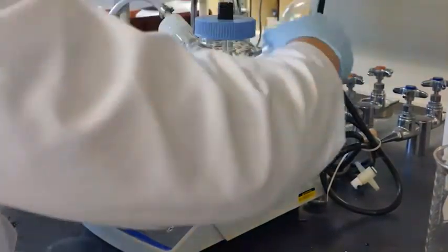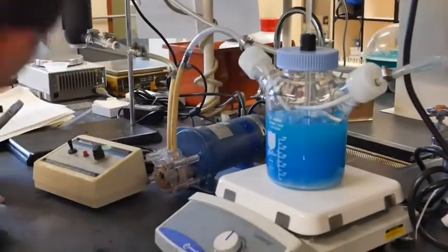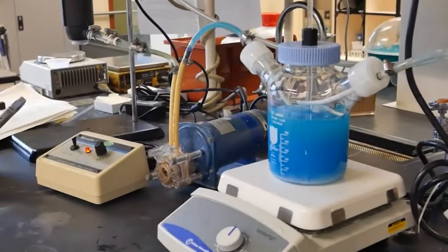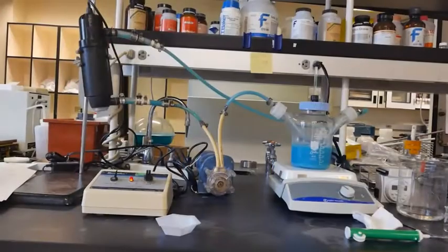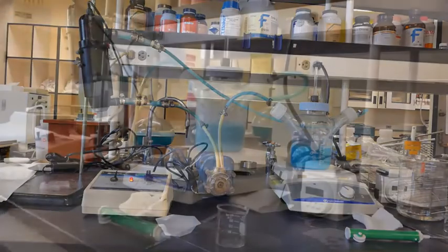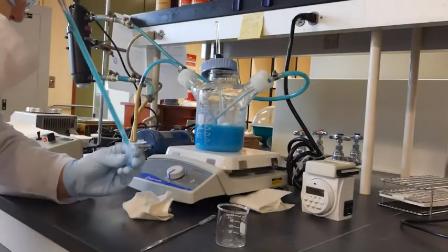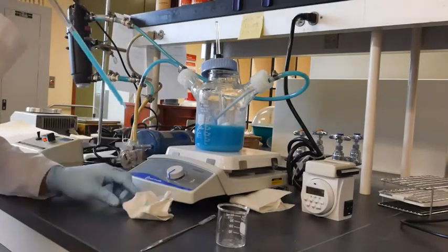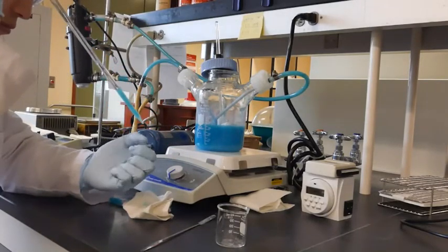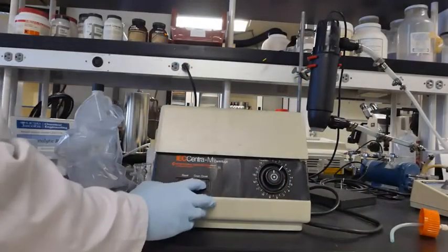Turn on the stirrer, plug in the UV lamp, and turn on the pump again to start cycling the solution. When the stirred solution has fully cycled through the system and reacted with the UV light, it is time to take a sample. Take off the cap and use a pipette to pull enough solution to fill two centrifuge tubes. Use a centrifuge to separate the precipitate from the solution.